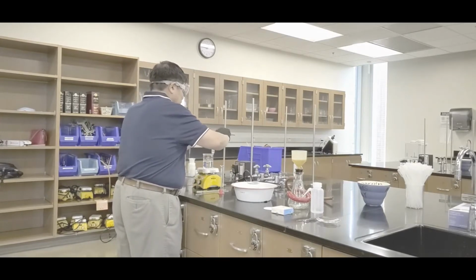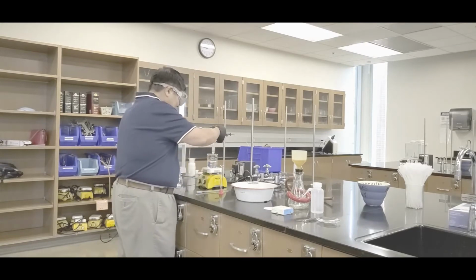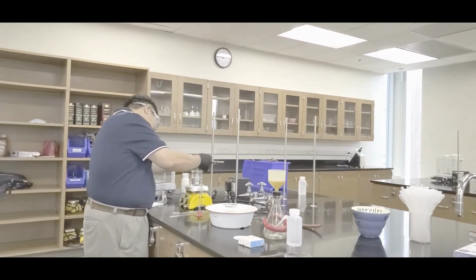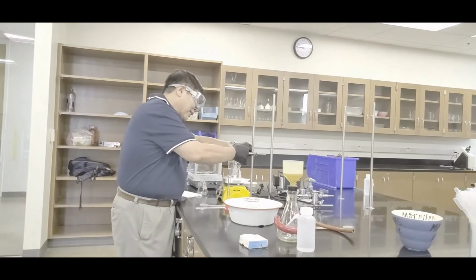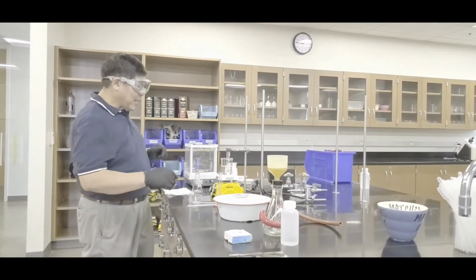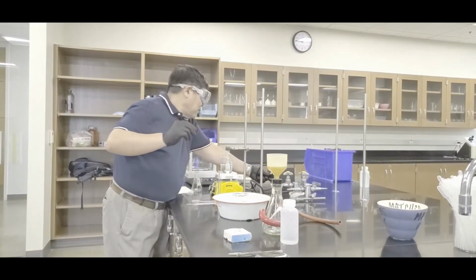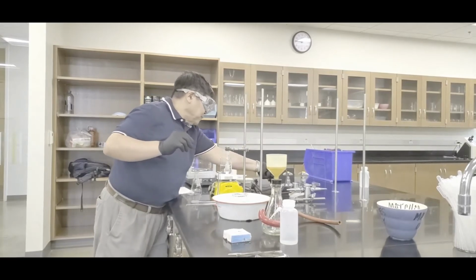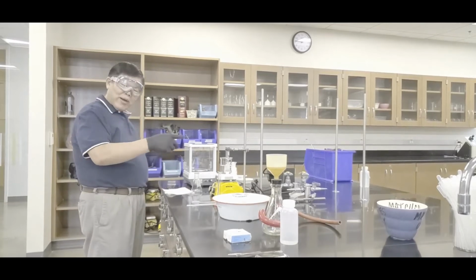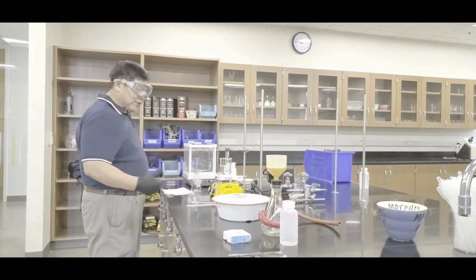So pinch it like that, tighten it. And then you move your setup and bring it down, so that your test tube is maybe about half an inch from the bottom or something like that. Okay, so it's set up. Now it's ready for plug in. Like that. And then the left knob, turn it clockwise all the way, and you'll see a green light right there. So now let it cook, okay?